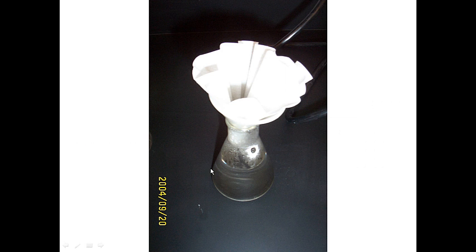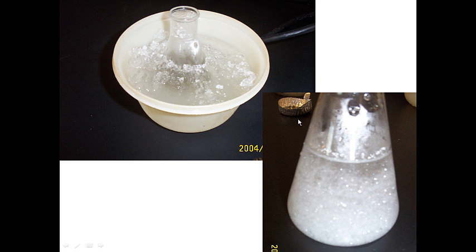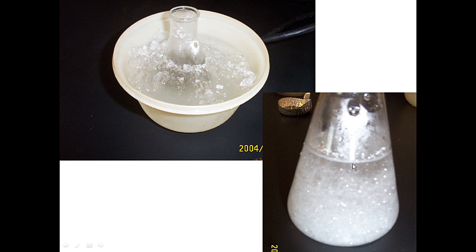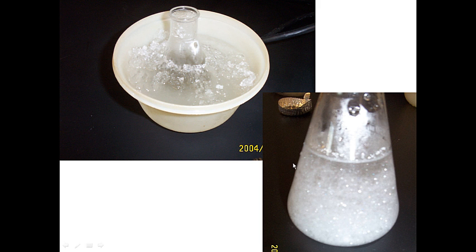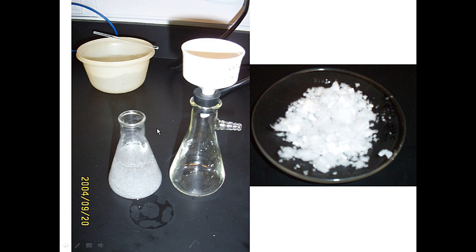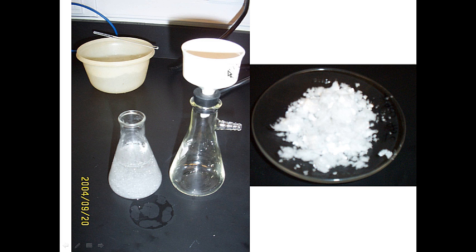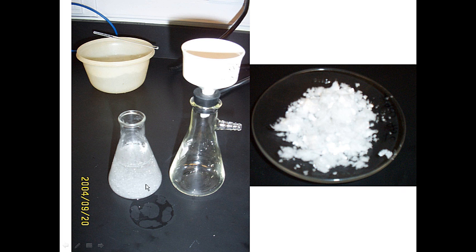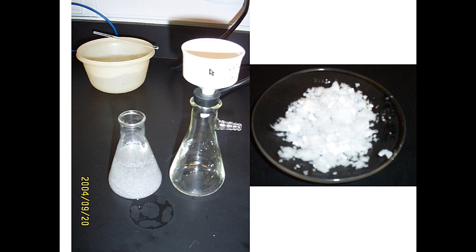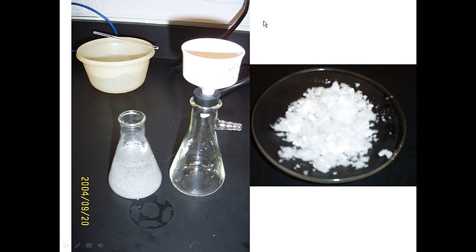Allow the solution to cool to room temperature; you will start to see crystals grow. Then put the flask in the ice bath, scratch it with a glass stirring rod, and much more purified crystals will begin to grow — nice large plated crystals. Then use the Buchner funnel and filter flask for suction filtration. Wet the filter paper with the recrystallization solvent, decant the solution into the filter flask, and wash with a couple of portions of ice-cold solvent.